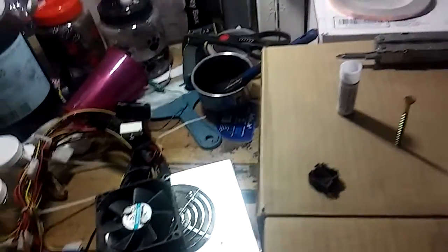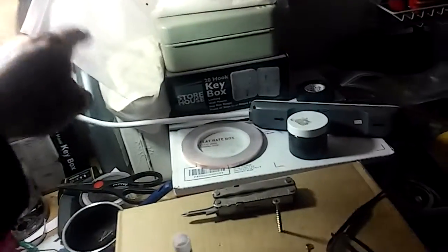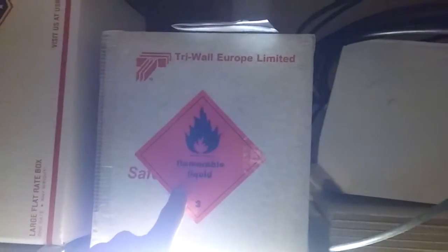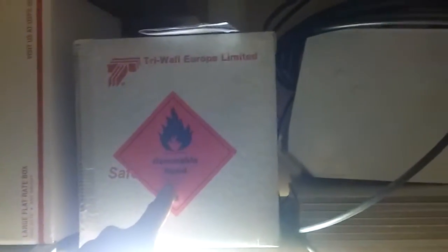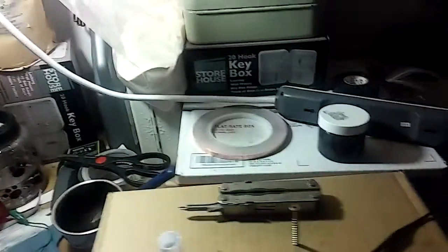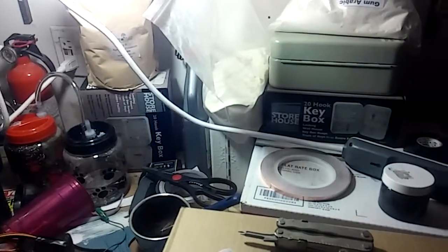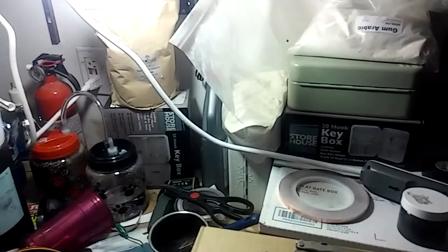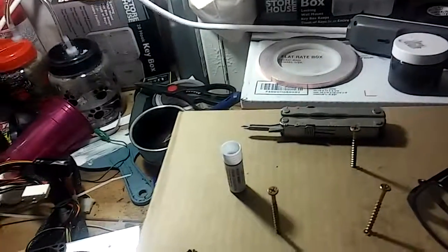Now I have all the materials I needed: a couple of different types of active material, a few different types of binders, and this special binder I bought after a lot of research. I got a supplier to send me a sample directly from Dow Corning — it's a xylene-based hydrophobic resin that's going to be the binder.